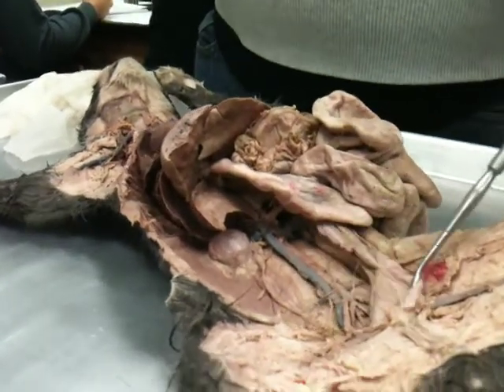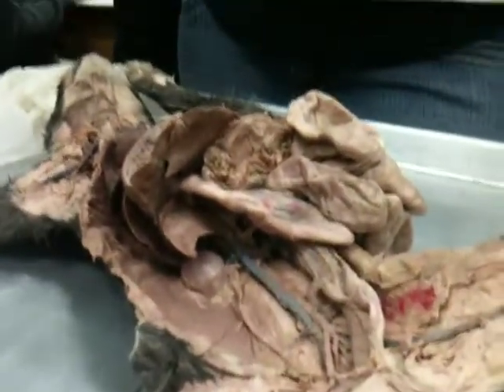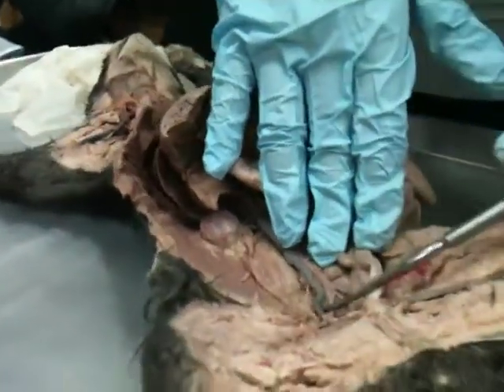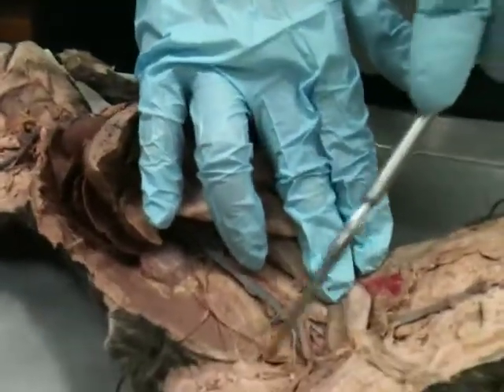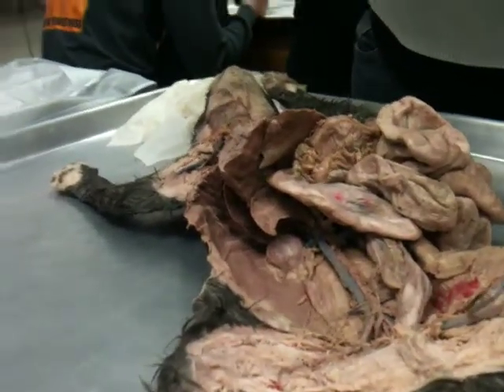Okay. Even though on most of these you can see the difference between those, I'm not going to have you differentiate, even though it says it on here. Yeah, for that one, you can just write iliac. Okay? So here's that right iliac vein, and then you can see the left iliac vein right there. And then we have the end of this abdominal body cavity. So where it exits the abdominal body cavity, it gets a new name.